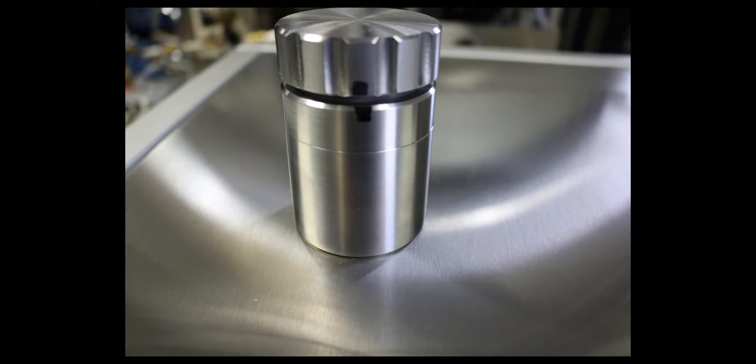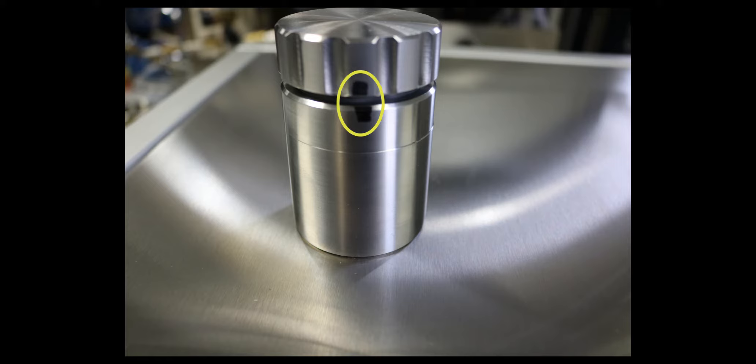Before opening the sample chamber, check to see that it is sealed tightly enough and using a marker, make vertically aligned marks, one on the cap and one on the fixed portion of the sample chamber, as shown. This will ensure that, upon resealing the chamber, the cap will return to the same position every time, which will in turn prevent variations in volume within the sample chamber.